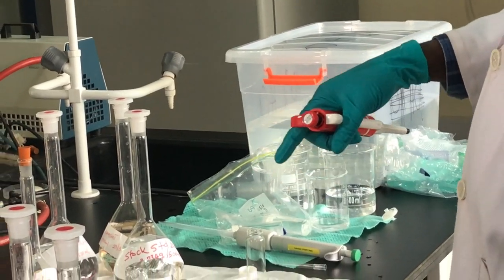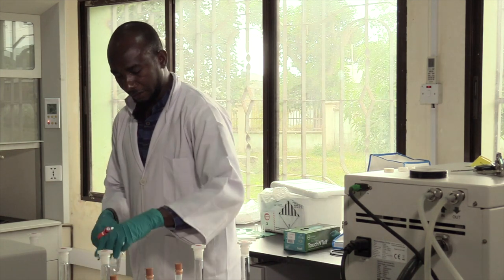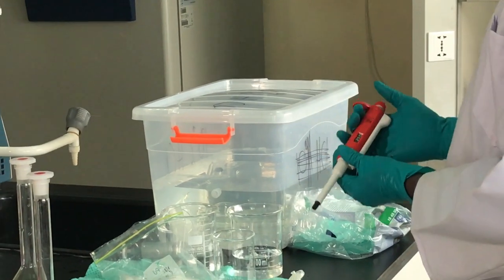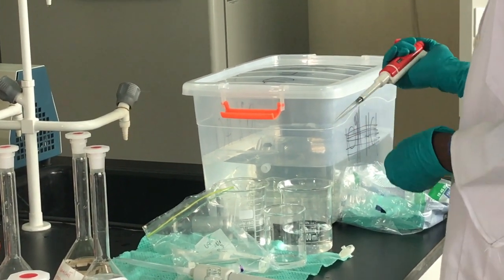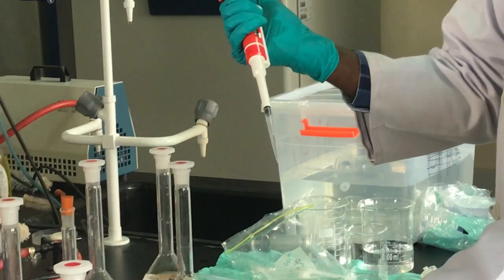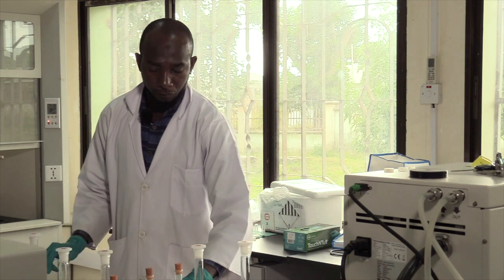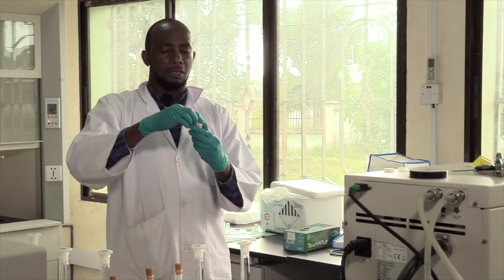We then add our reagents into these test tubes. First, we add vanadium(III) chloride — 0.26 mL using the micropipette already calibrated to 0.26. Next, we add the Griess reagent, putting in 0.25 mL. After adding both reagents, we cover the test tubes with their lids and place them in a water bath for 30 minutes.